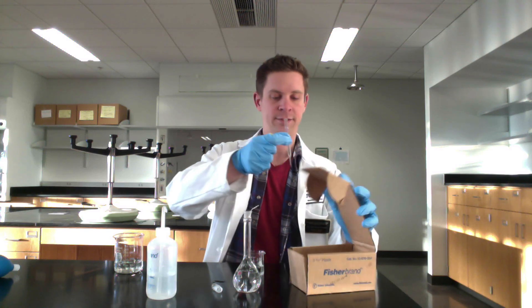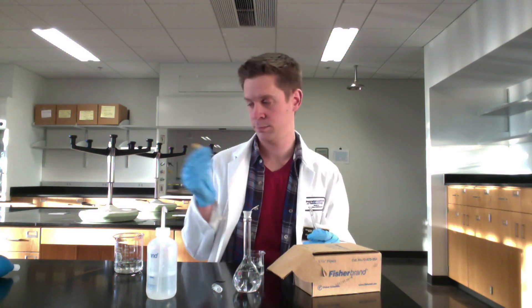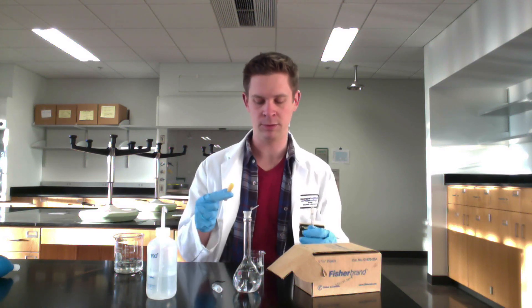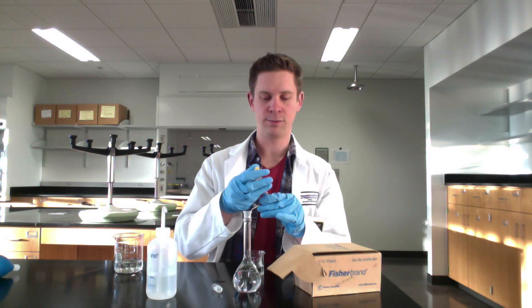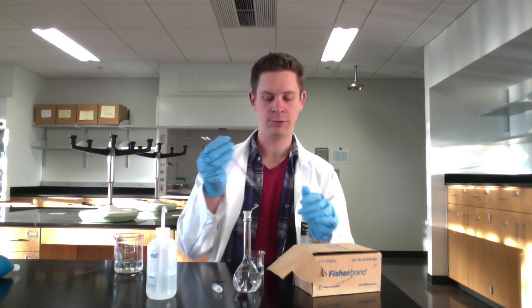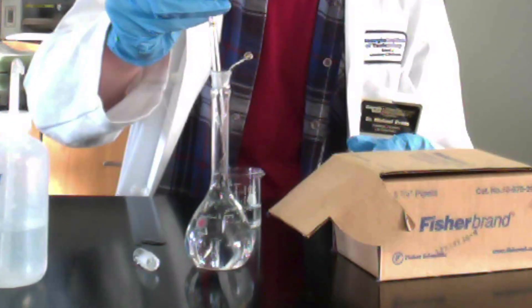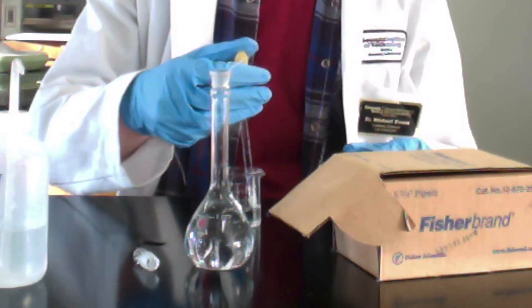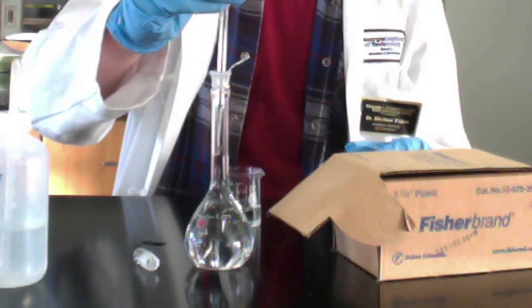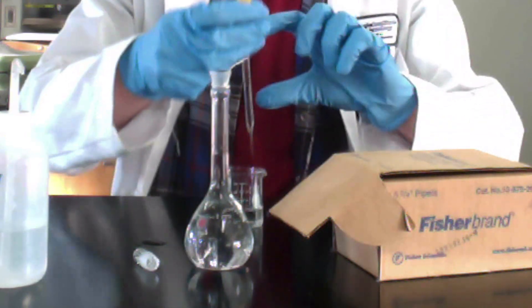You don't need to be careful how much volume you're delivering — just watch the volumetric flask. A Pasteur pipette looks like a serological pipette but is made of glass with no markings. Instead of a blue pipette bulb, we use a smaller Pasteur pipette bulb that fits over the end snugly. We use it the same way: squeeze, dip into the liquid, and dispense. As a rough rule of thumb, a Pasteur pipette holds about one milliliter of liquid, though that can vary depending on stem and body length.